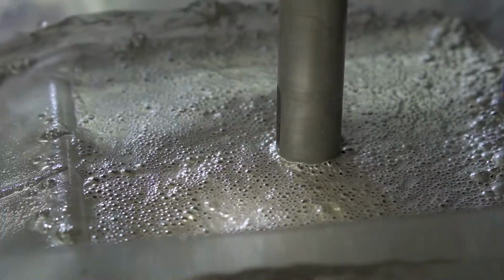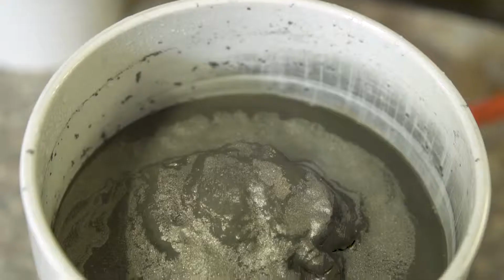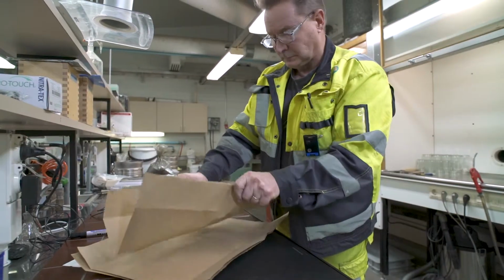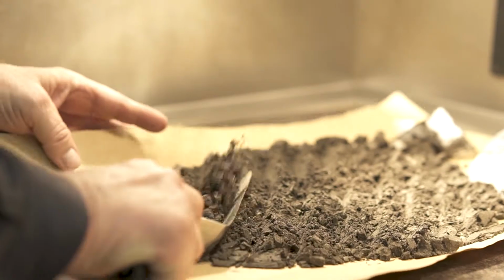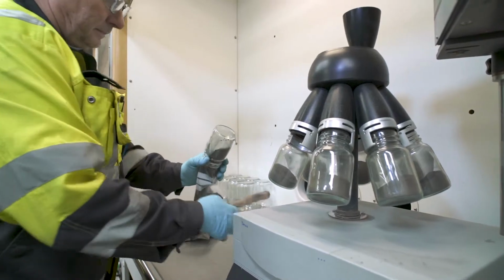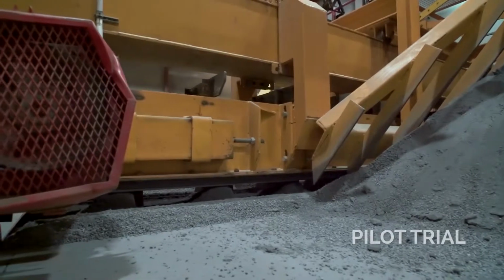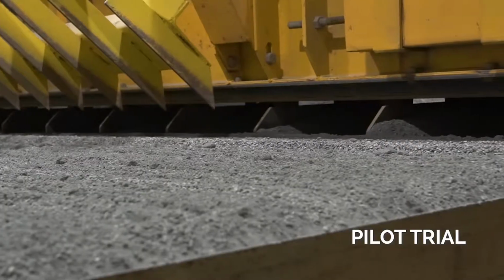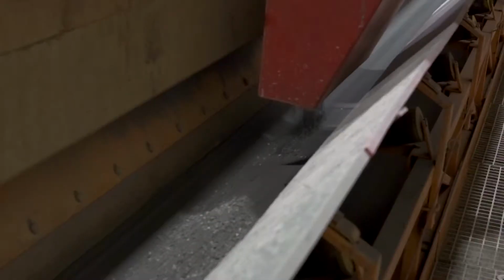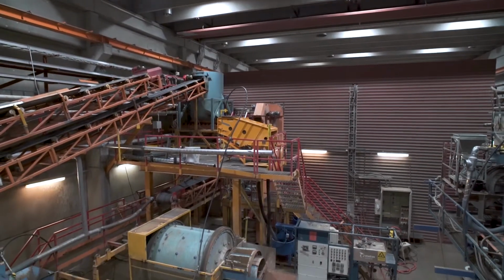The flotation test mainly contains ore grinding, slurry conditioning with addition of reagents, floating, product filtration, and drying. The dried products, concentrates and tailings, are split into small samples for chemical analysis. Pilot-scale test work, together with experiences from operating plants and laboratory tests, are most commonly used when the design parameters and operating data are acquired for process design and economical calculations.